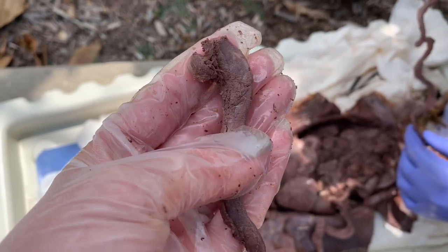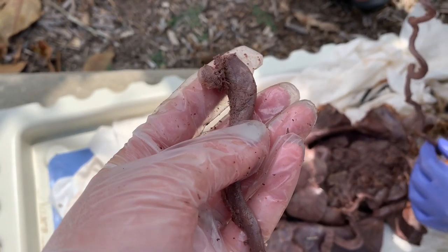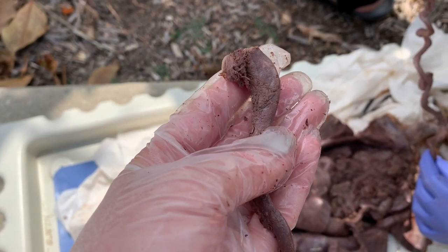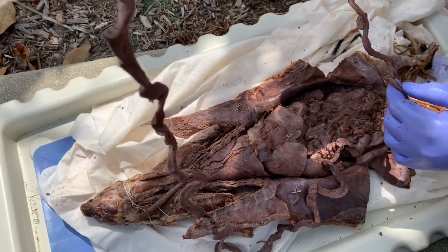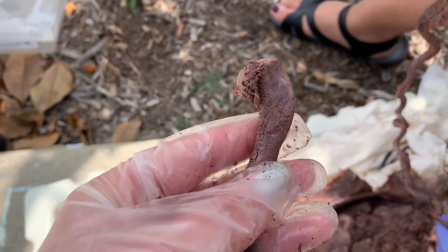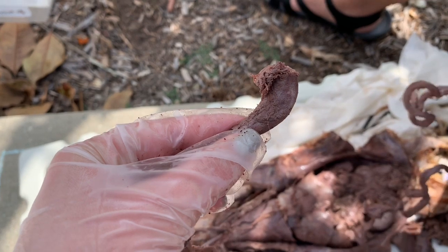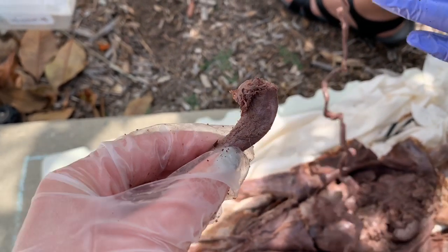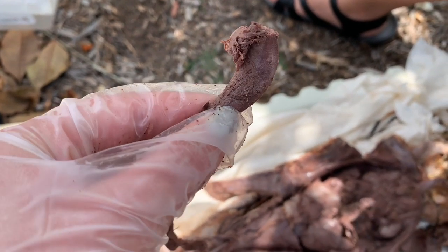So right here, I have the duodenum, which is the first section of the small intestine. The function of the duodenum is mainly chemical digestion of food and compounds. And basically this leads into the rest of the small intestine, which is divided up into the jejunum and the ileum. So the small intestine as a whole is where most of the breakdown of food occurs. And after digestion occurs, then nutrient absorption also occurs in the small intestine.